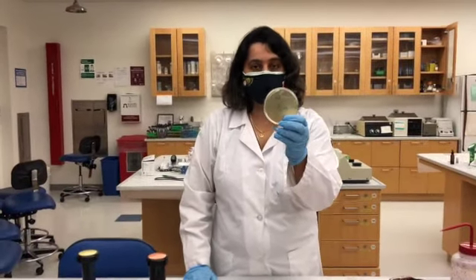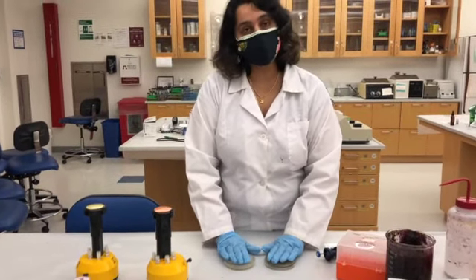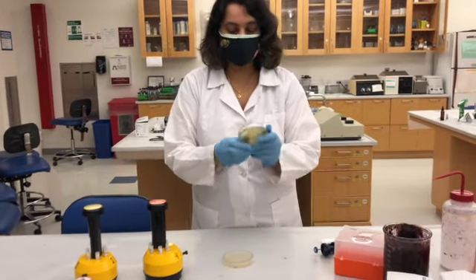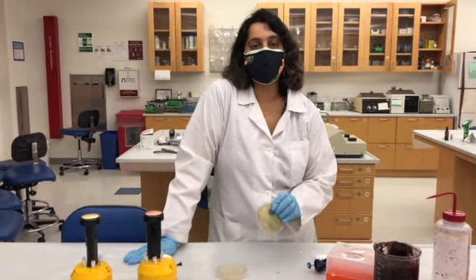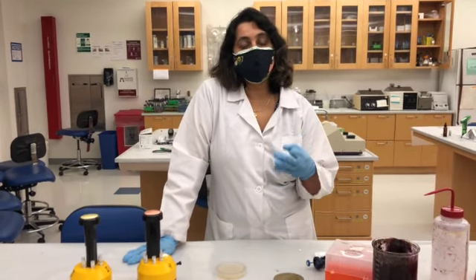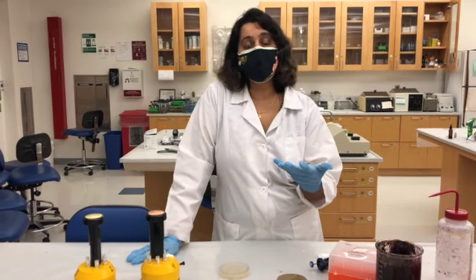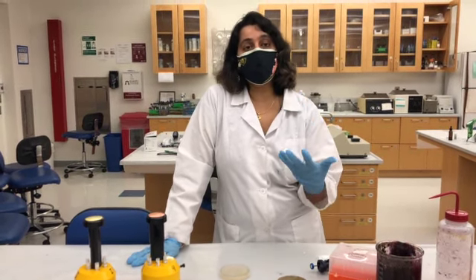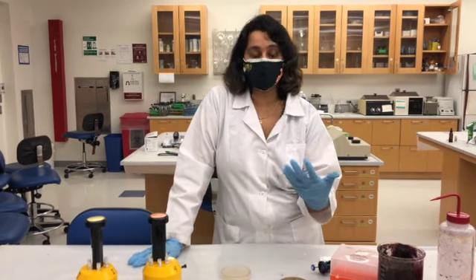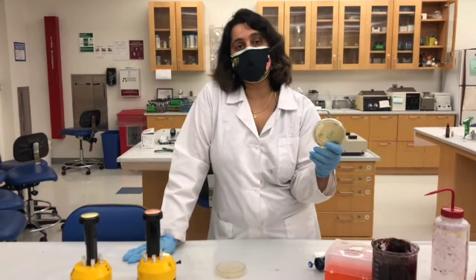Pseudomonas aeruginosa bacteria. So the first step is to spread the bacteria on the TSA plate and then dispense these antibiotics. Why do you think I chose Pseudomonas aeruginosa? Pseudomonas aeruginosa, Staph aureus, and then E. coli and Enterococcus faecalis. All these 4 different bacteria are very popular to cause so many nosocomial infections, the hospital acquired infections. Especially Pseudomonas aeruginosa is resistant to many antibiotic treatments.